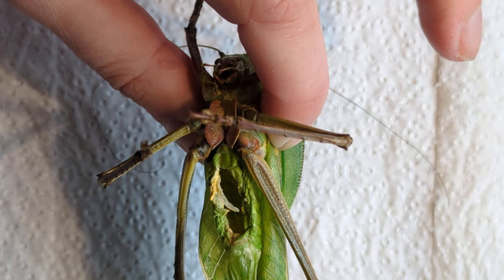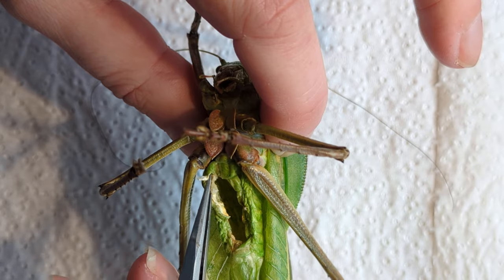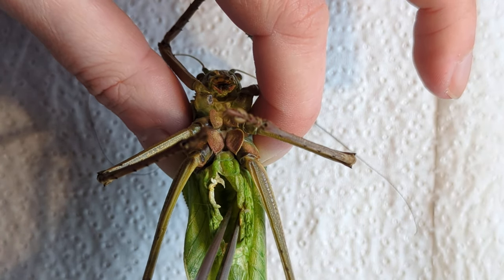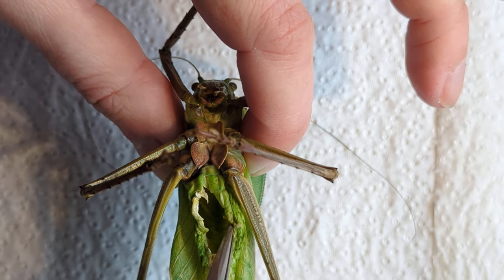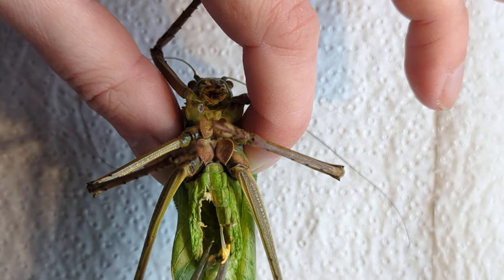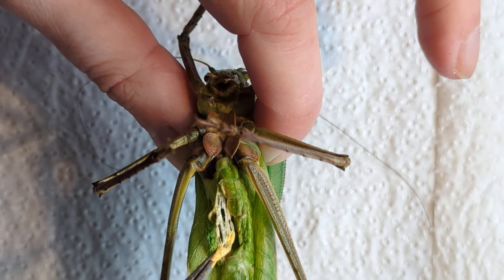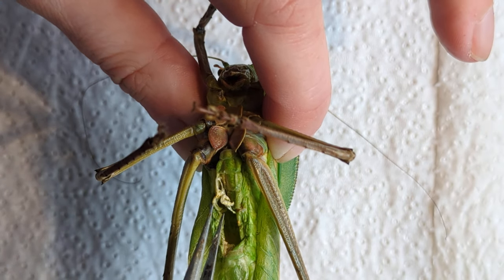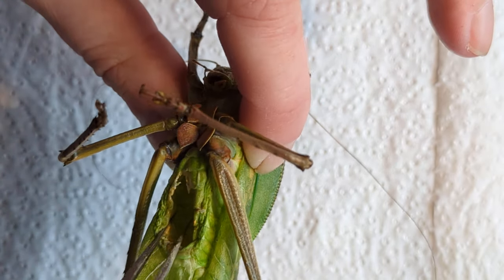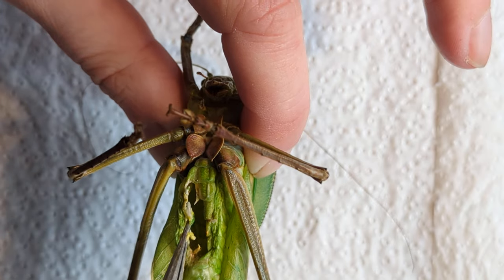I'm switching back to the other tweezers. That is something I tell everyone to invest in — you don't need a lot of expensive equipment to get started with this. Pinning butterflies, cleaning insects, any of it. But do invest in a good pair of tweezers. They don't need to be expensive, but they do need to be good quality. I got these for about £11.